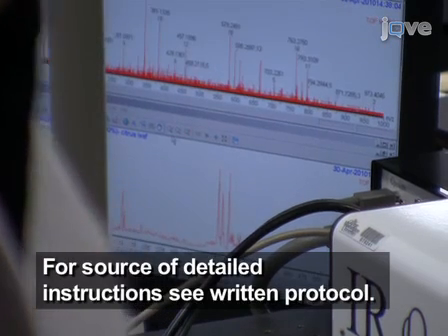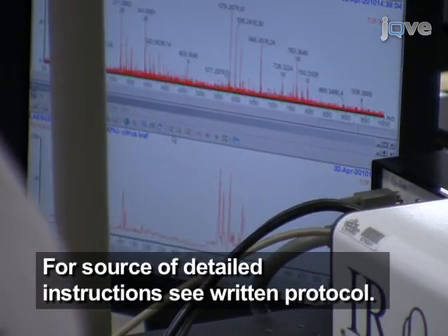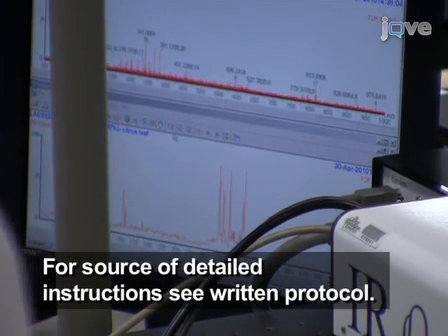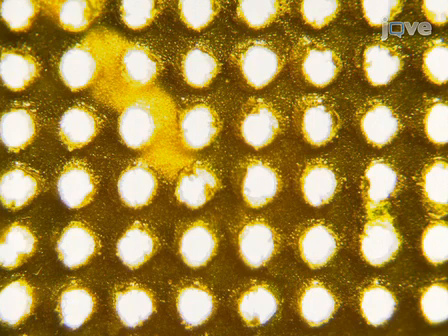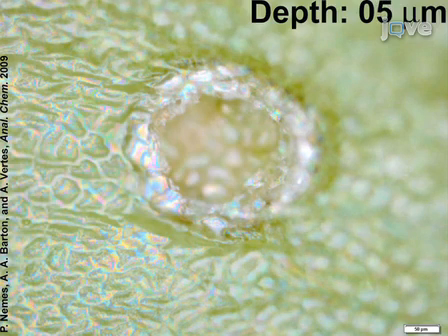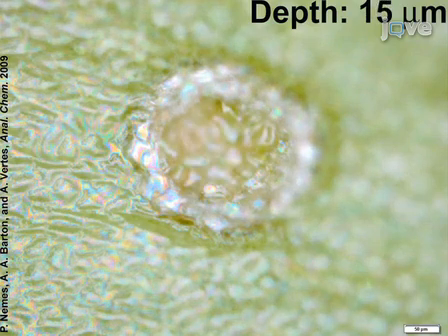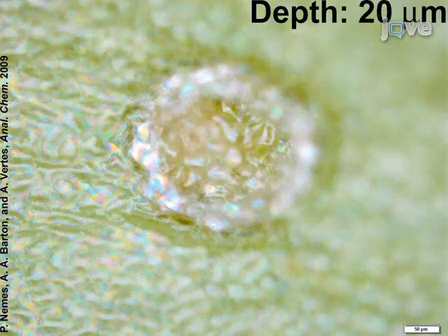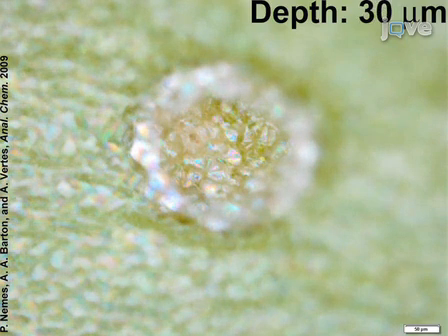Carefully adjust the relative distances of the LAESI setup to optimize for LAESI ion yield, while keeping the laser beam, the emitter, and the orifice axes in the same plane. With an optical microscope, determine the lateral dimensions of the ablation crater on the sample. For three-dimensional LAESI imaging experiments, perform ablation with individual pulses and determine the depth of a voxel using, for example, the Z-stack mode in optical microscopy.